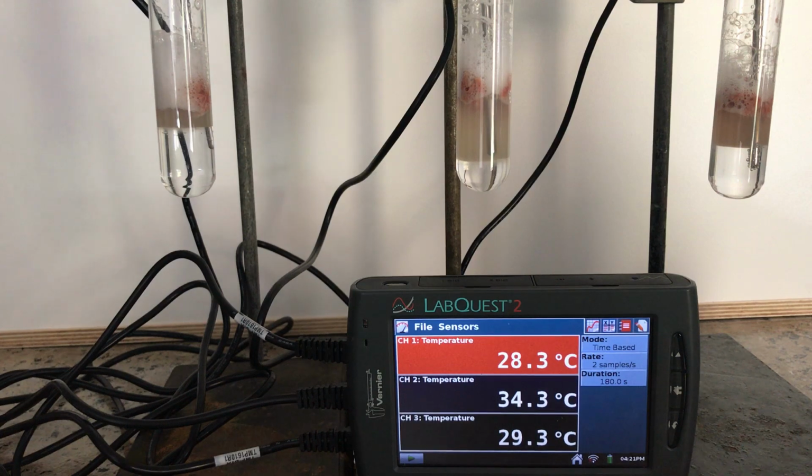Could we have stood with just 1 tube? If we'd done 1 tube and it was the high temperature, we might have had an outlier. If we did 2 tubes and they were at opposite ends, we would have had an average that might have been not too high or too low. So this way we have 3 measurements. We're going to take the average of these 3 measurements, and this is for the liver.